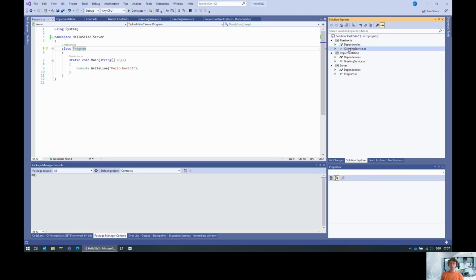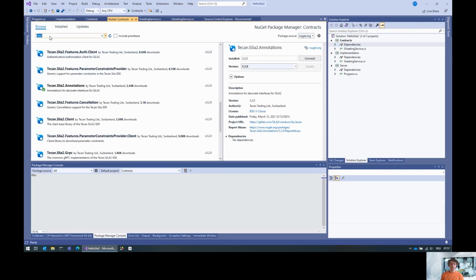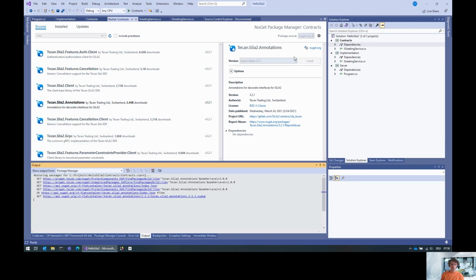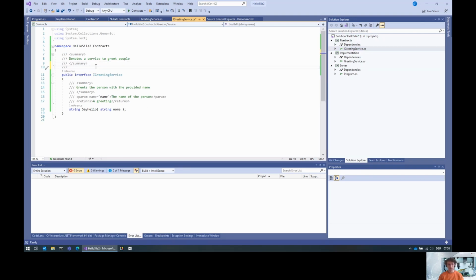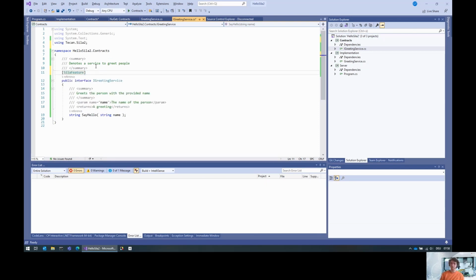The first thing that we need to do now is to mark the interface that is going to be exposed. For this, we add a new project reference to the SiLA 2 annotations. Here they are. Install. What this annotations package gives us is an attribute that says SiLA feature. This attribute is used to mark interfaces that are meant to be exposed through SiLA 2. And there's also a couple of other attributes.